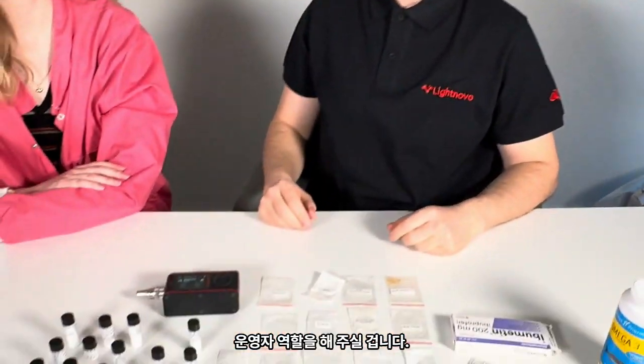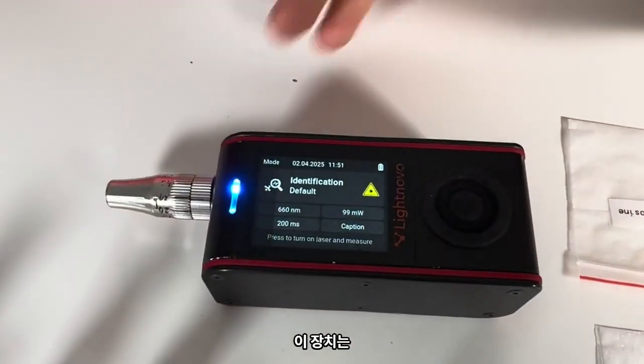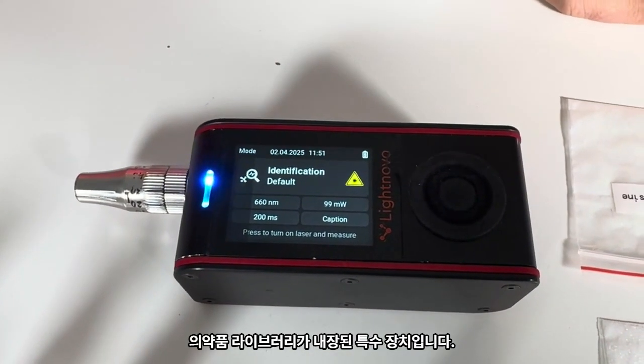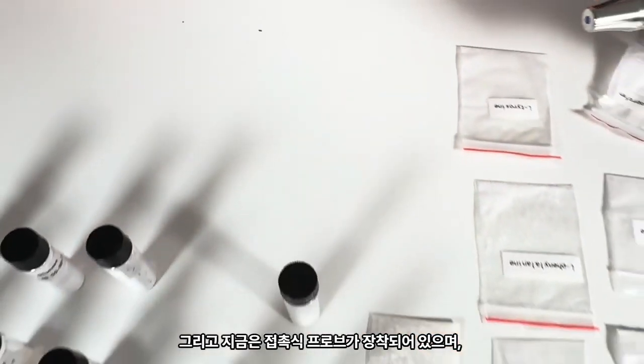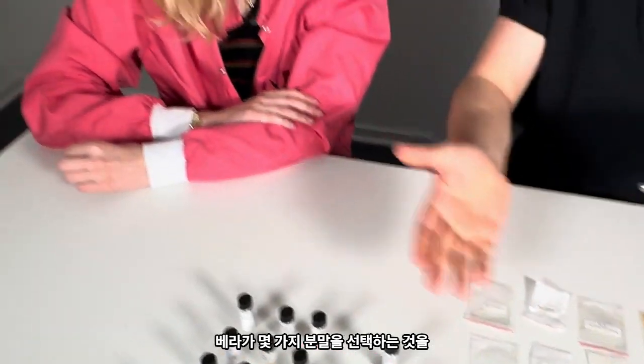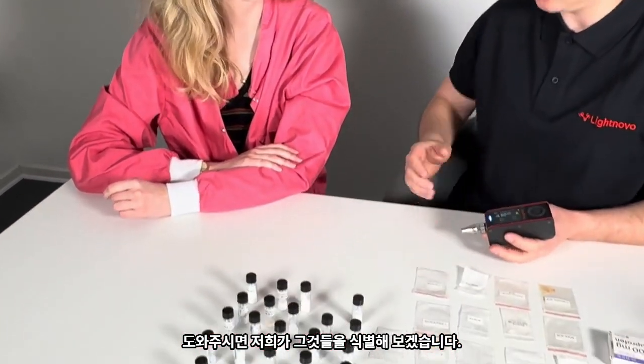And Yaroslav, let's take attention on the device again. It's a special device that has an inbuilt library of pharmaceuticals. And right now it's with the contact probe. And Vera, help us select some powders and we will try to identify them.